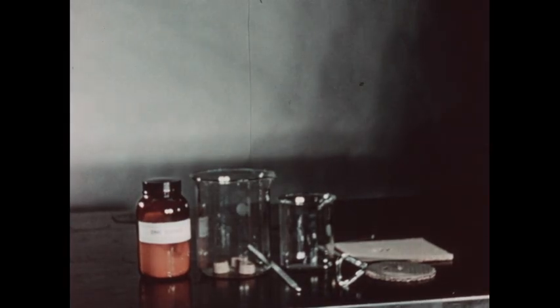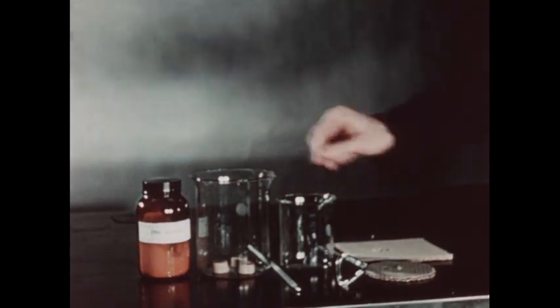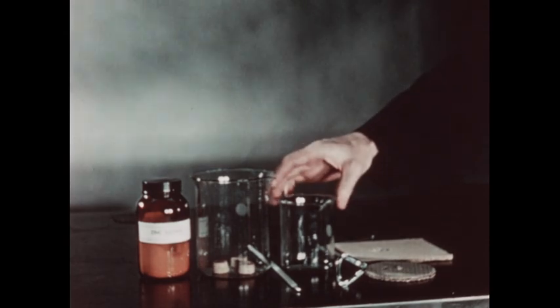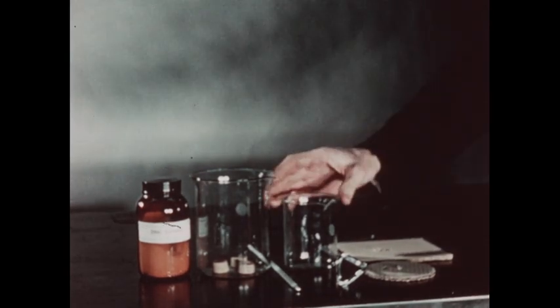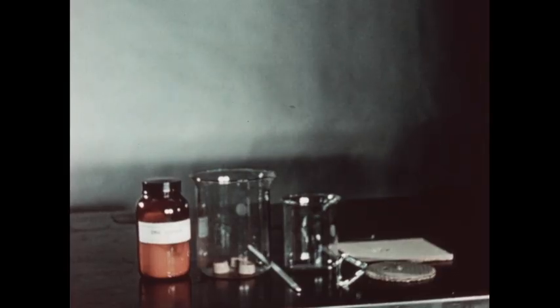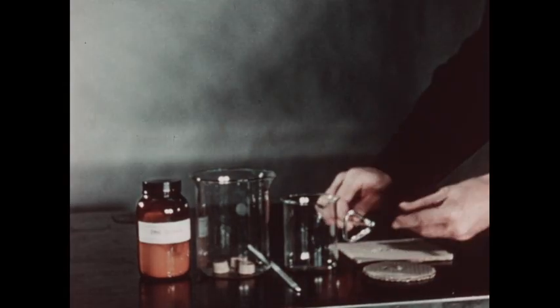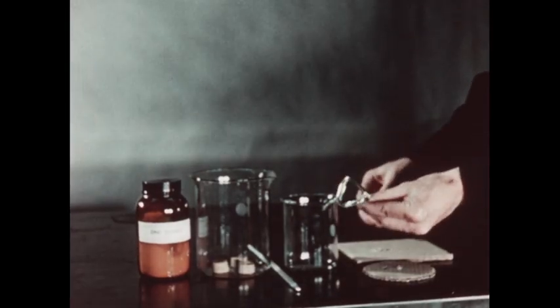Assembled on the table are the components of a crude calorimeter. The large beaker is 1 liter in capacity, and the small beaker 400 milliliters. The weight of the small beaker has been determined before the experiment starts and has been found to be 137 grams. A stirrer has been prepared by bending one end of a glass rod into a triangle.